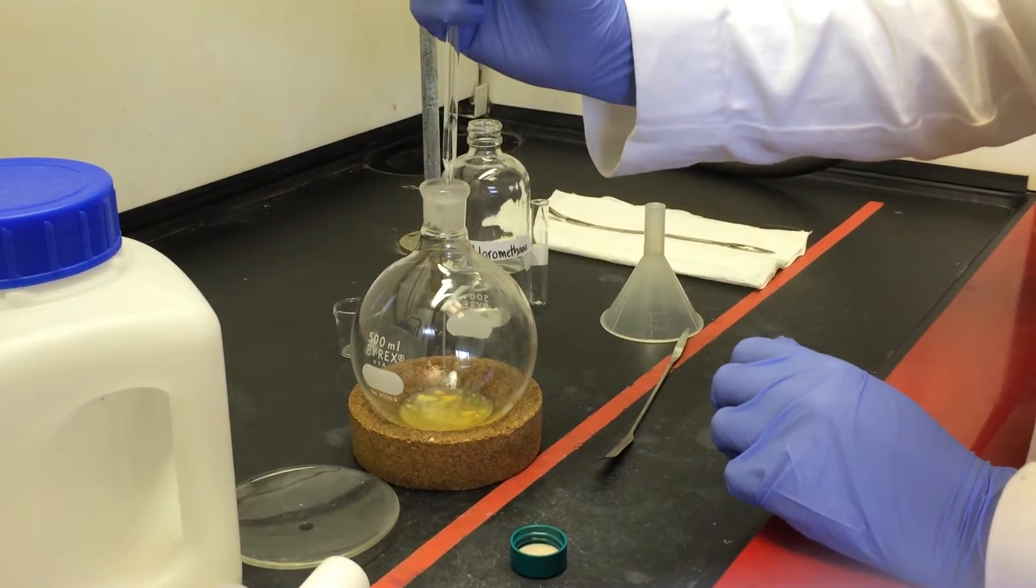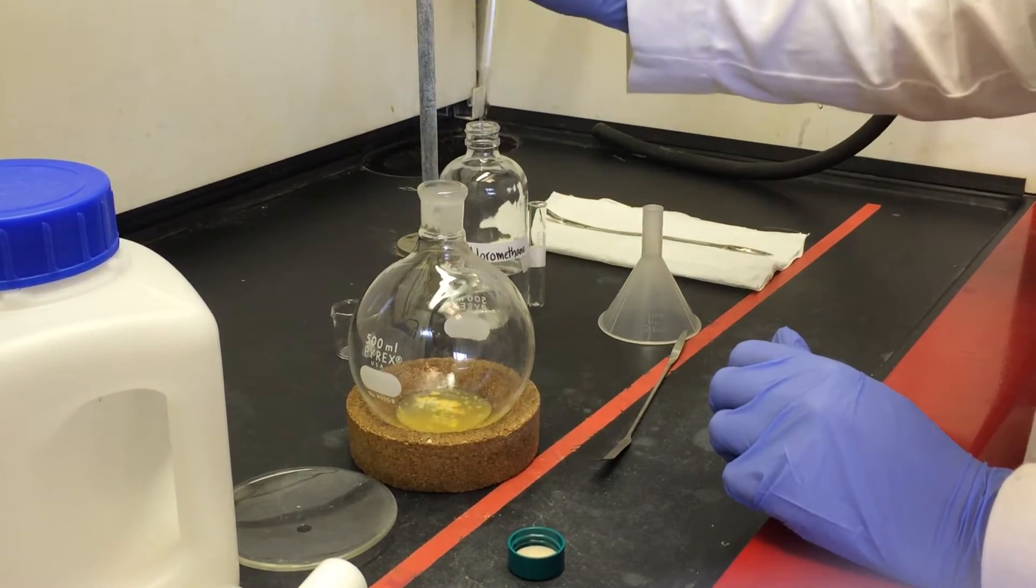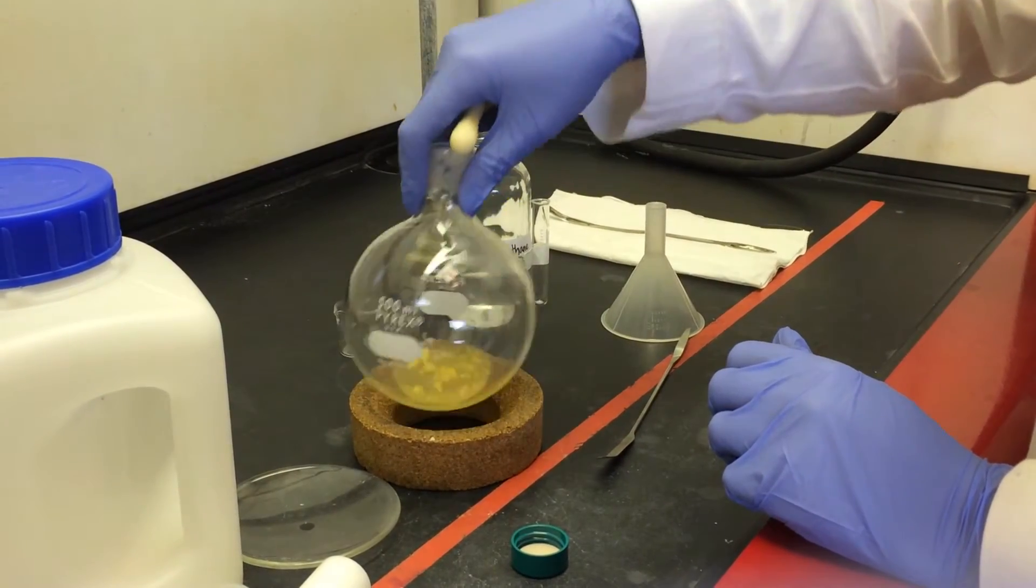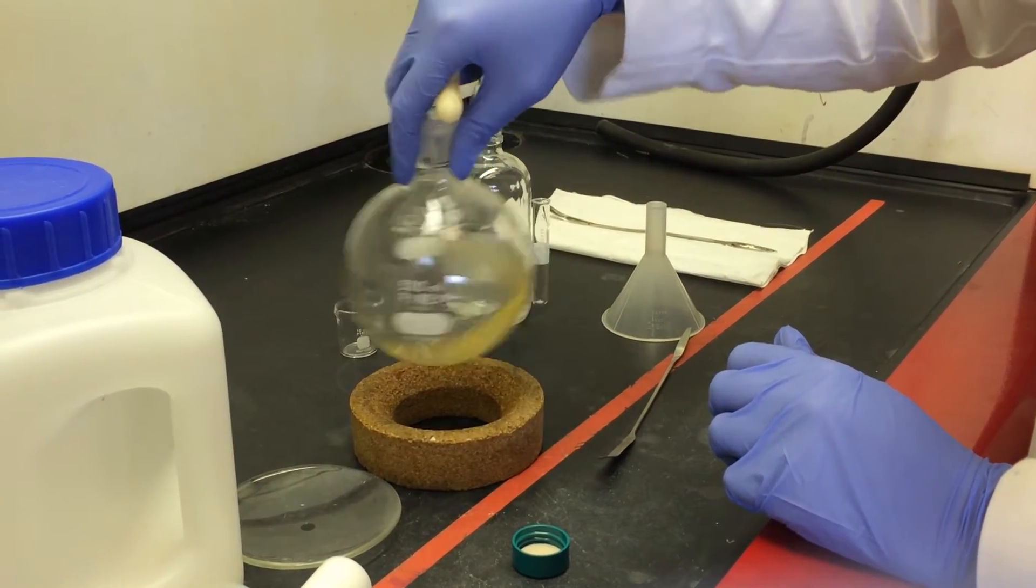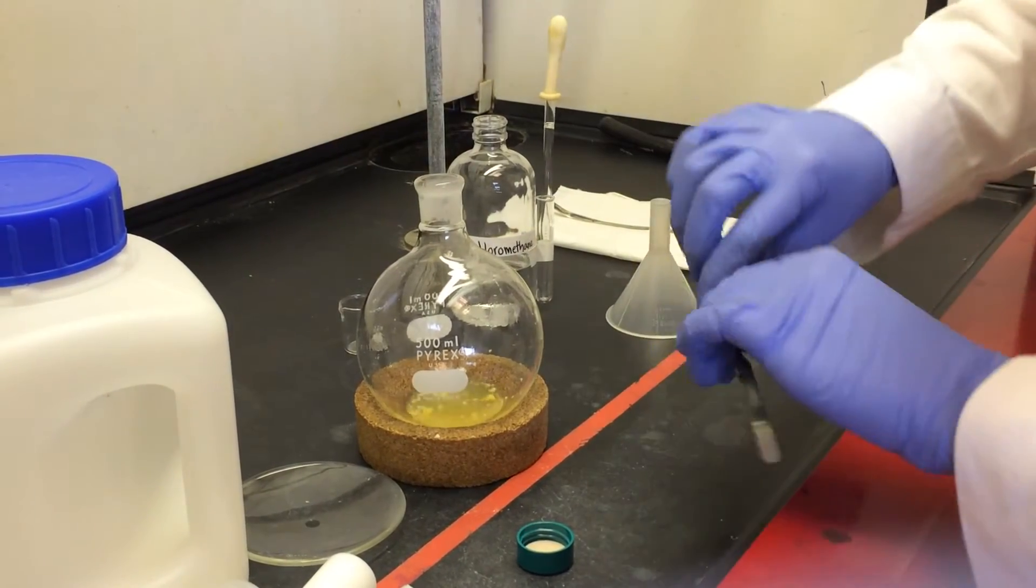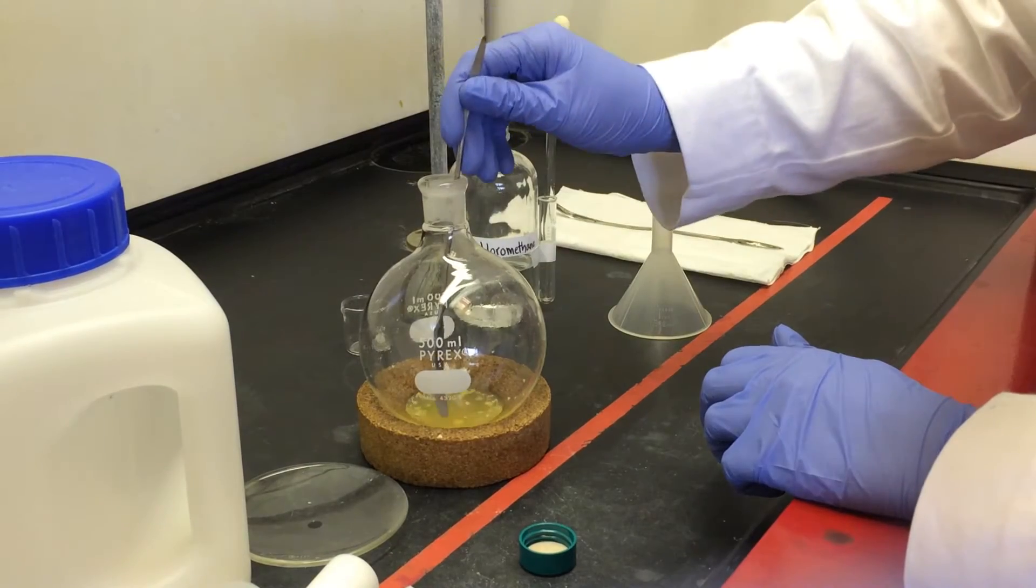Next, you want to dissolve your sample in dichloromethane, stirring occasionally. You may need to use a spatula to break up the larger chunks.